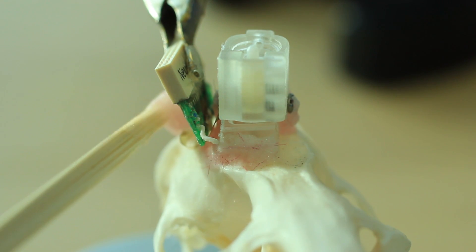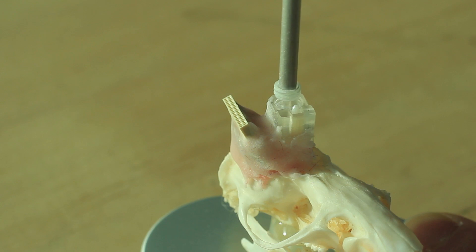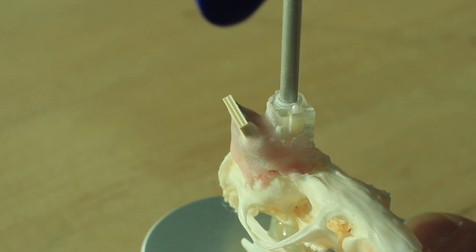Cement the connector in place, angling the connector slightly away from the O-Drive. Finally, close the cap with the top cover.